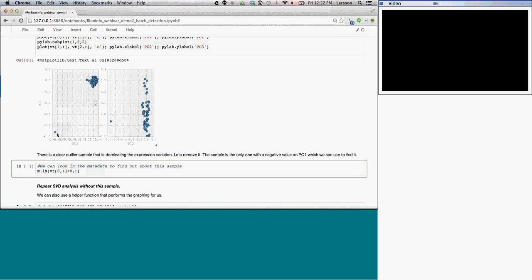Since we look at PC1 right here, this sample is the only one that has a negative value. Everything right over here is positive. So I can find which one I'm looking for by just looking at the first singular vector, which values are less than 0. This would be the sample that I'm interested in.